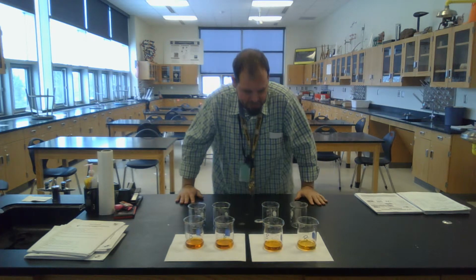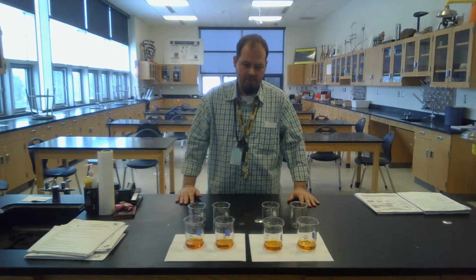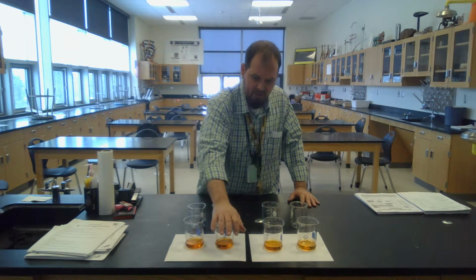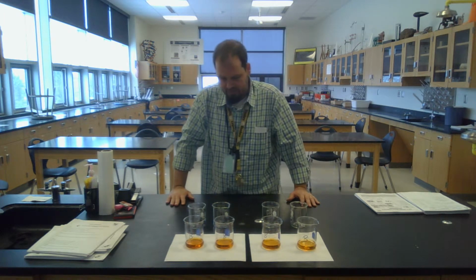All right, good. So it was a complete disaster the first time. If you want to see the video, I have it saved. You can see the video. This one took about 3 minutes longer, and this one took about 15 minutes longer, and this one didn't even go by the time I poured them up.